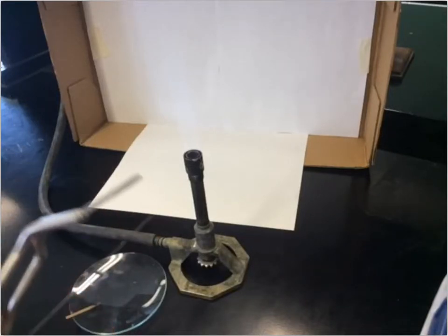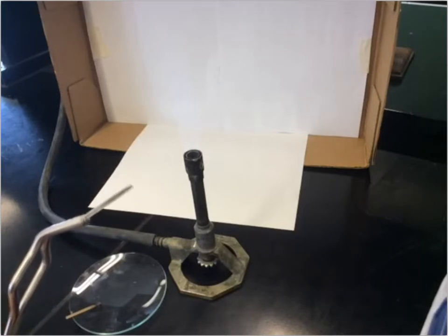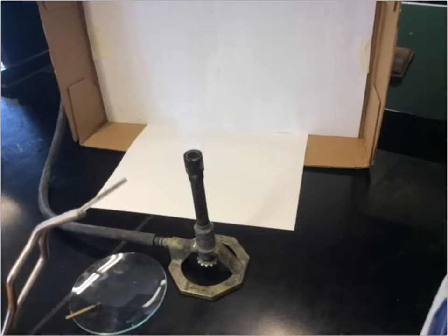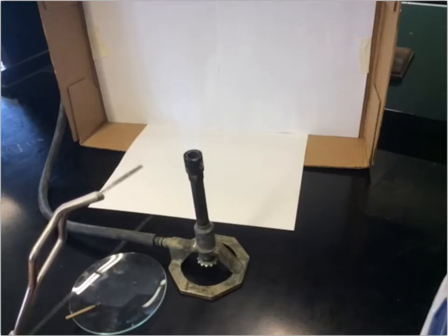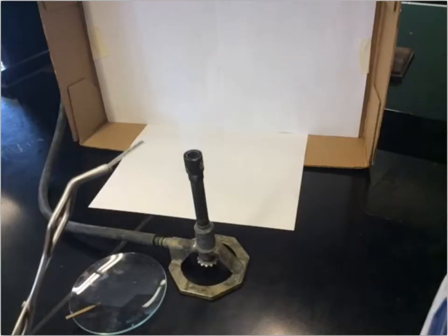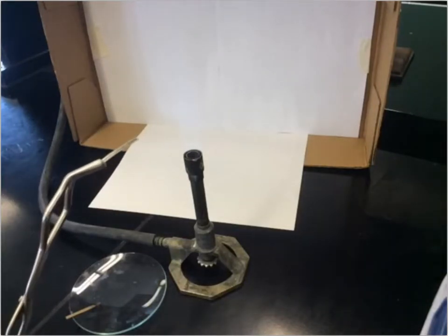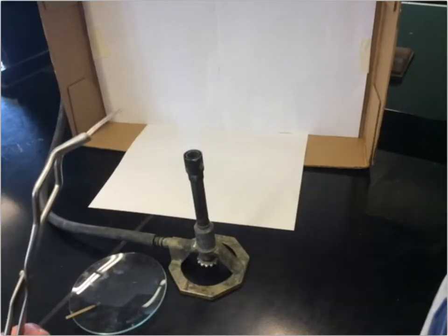I'm going to use these tongs to hold the magnesium ribbon into the flame. Now if you were doing this in person we'd say don't look straight at the flame — the light is very bright — but what gets captured on the camera is fine. When this magnesium ribbon goes into the flame, that's going to help kick-start the reaction between the magnesium and oxygen gas in the air.